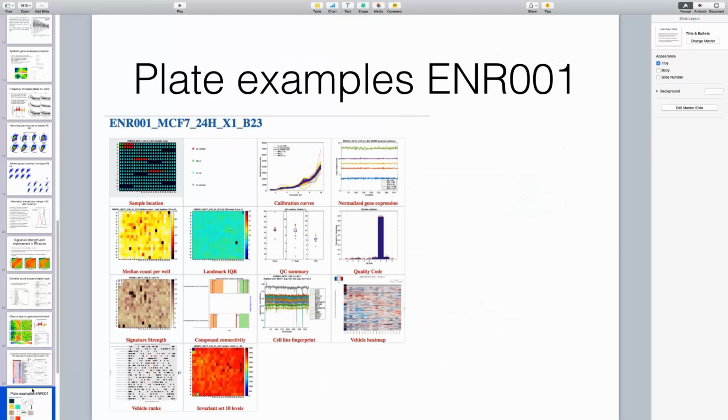So I have a small example. We have a small data set of 6 plates. I'm not going to talk too much about what it is, but usually when you have the L1000 data, you get these quality checks, and in terms of the technology, all the quality controls pass pretty much. If we look at the median count per well, there's no apparent problem in the counts, and the invariant set of the 10 levels looks fine. So we don't see any of these patterns showing up in the quality control.